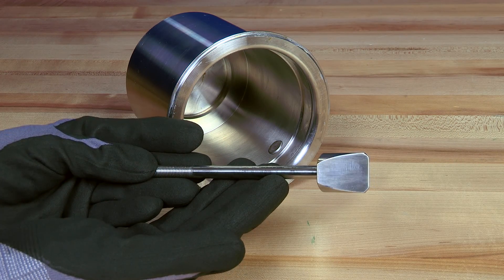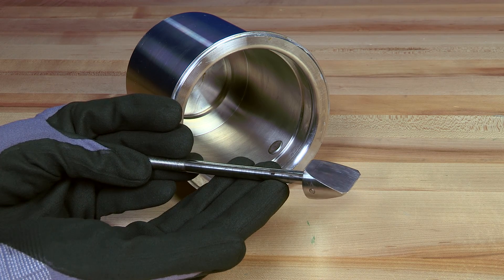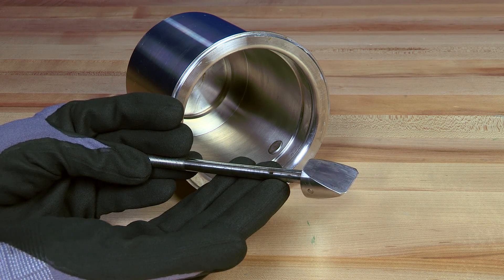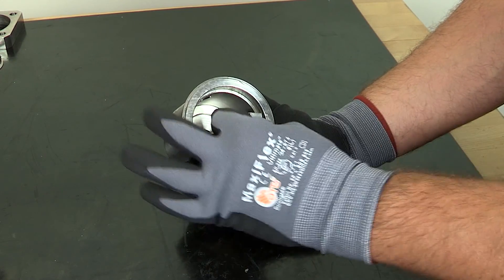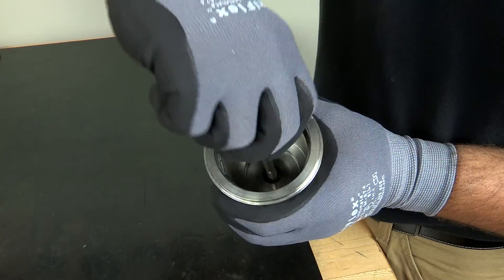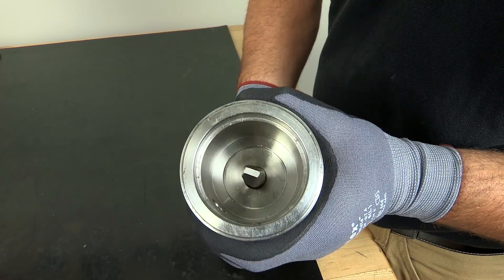The piston stem sub-assembly comes from the factory already assembled. However, there are variations of the piston that allow for different rates of flow. Make sure you have the proper piston assembly and then carefully insert it into the bonnet. Turning the stem as it's inserted through the O-ring will help to minimize damage.